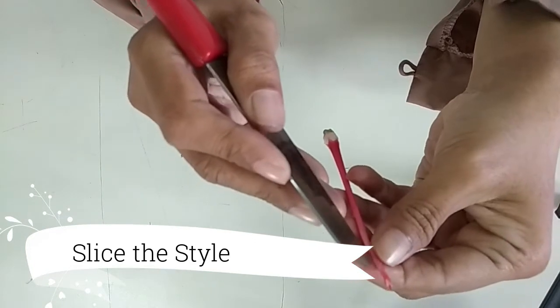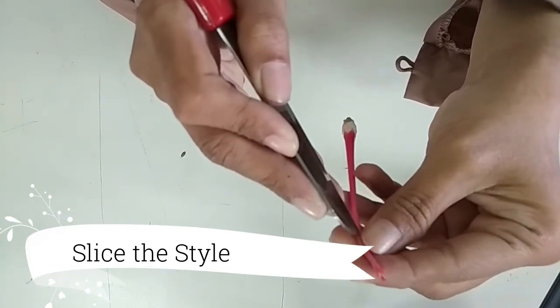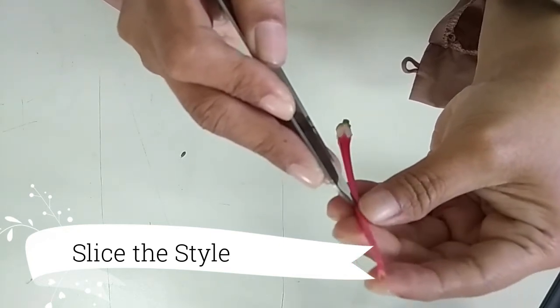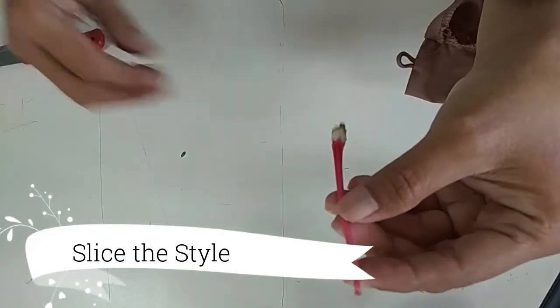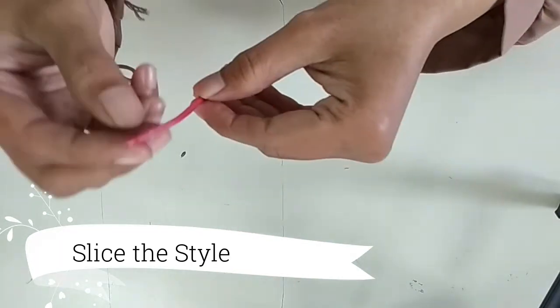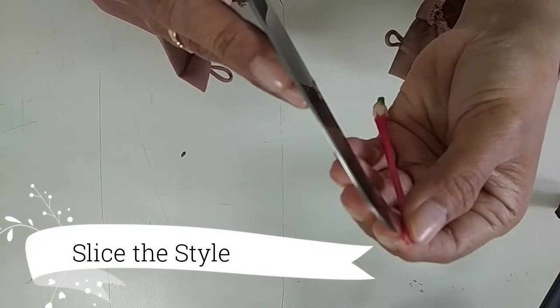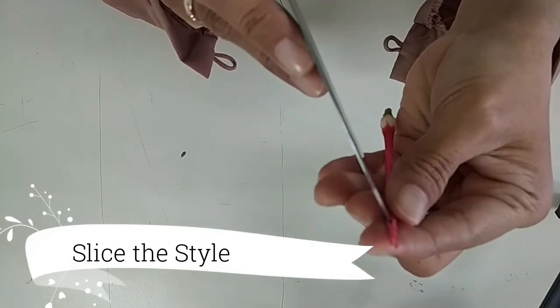Try to slice as straight as possible. The tidier the cut, the easier it will be to inspect the plant. Don't slice all the way through. Gently push down the scalpel as you slice to only cut through half of the layer.